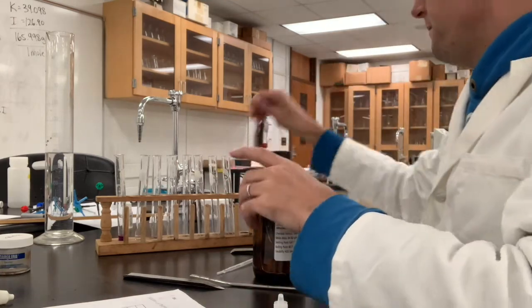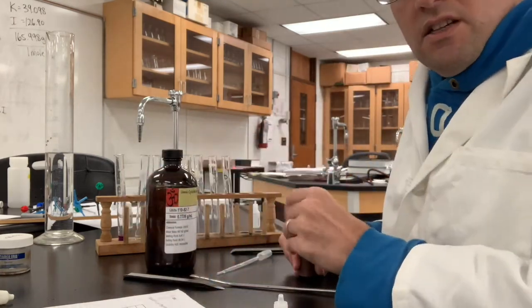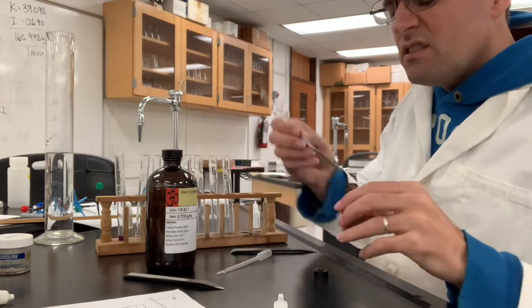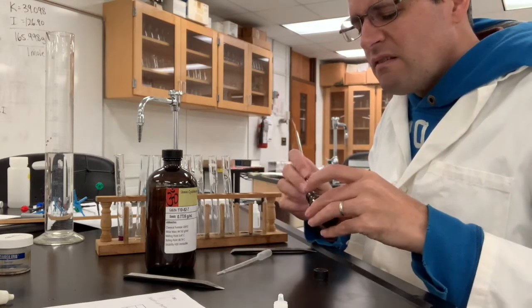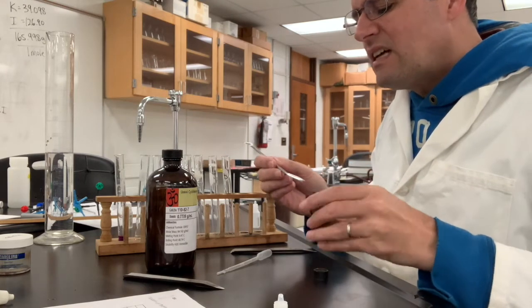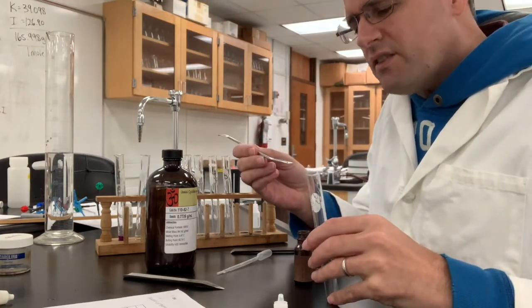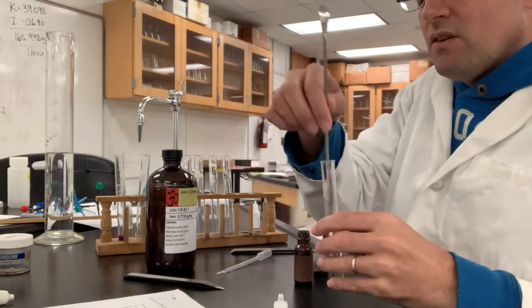Iodine — I'm not sure if I can fish this out or not, so we're going to check to see if iodine is soluble. This stuff kind of smells like bleach — very interesting substance. I'm going to add a single crystal of this to water. Iodine has a dark reddish-brown color, so we'll be able to see if it dissolves or not.